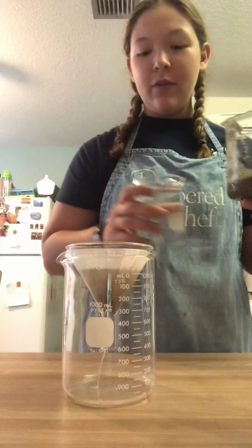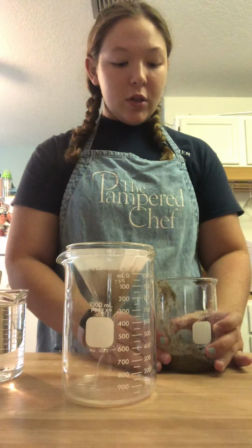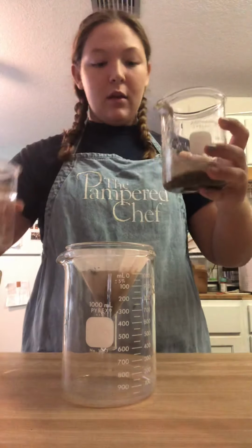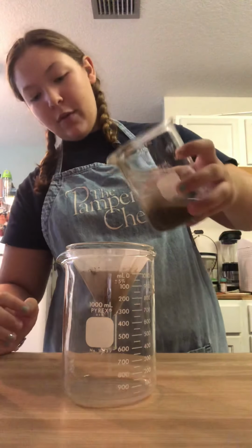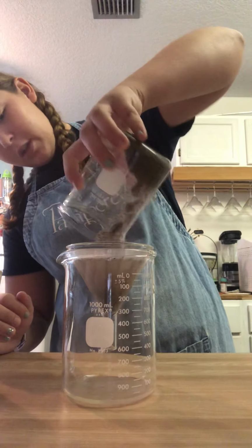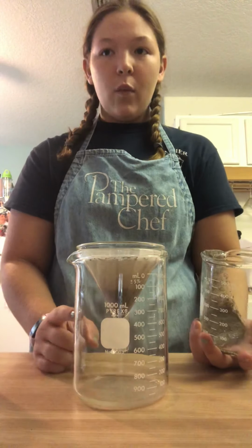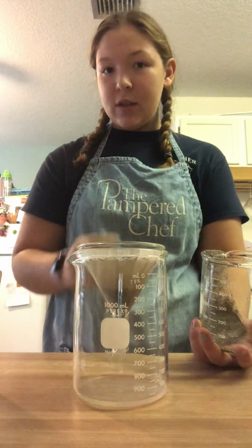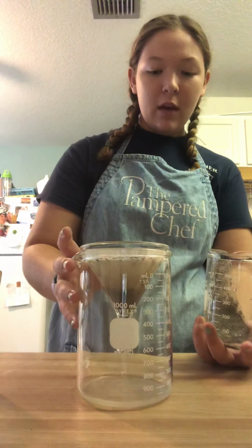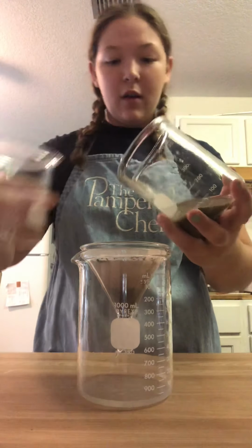So we have this beaker full of extra water to get this leftover sand that's in the bottom. So what we will be doing is we will just pour a little bit into the beaker, move it around, pour some more salt and sand mixture, and as this is filtrating, we are separating the sand from the dissolved salt, which is the definition of filtration, separating a mixture. So this is going to take a little bit of time. Add some more water.